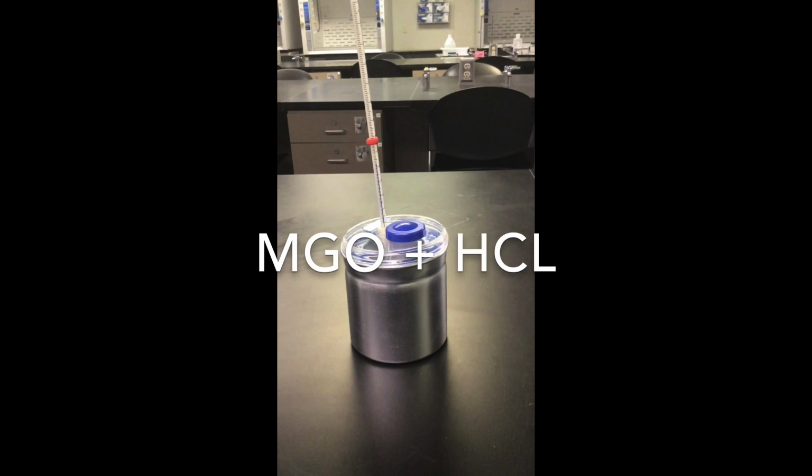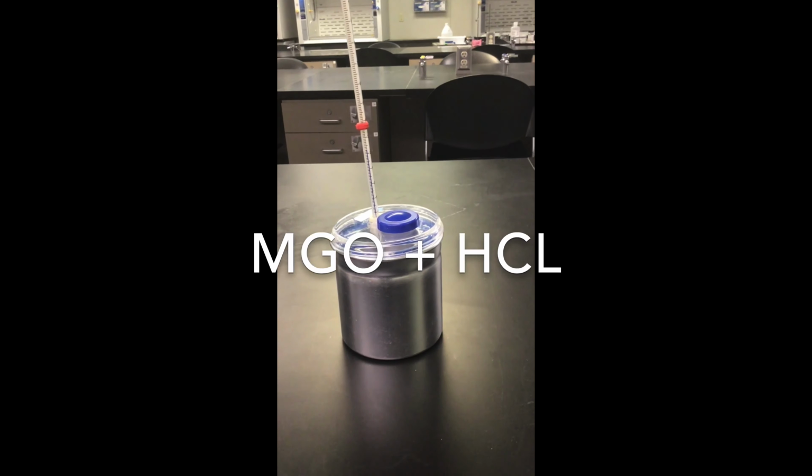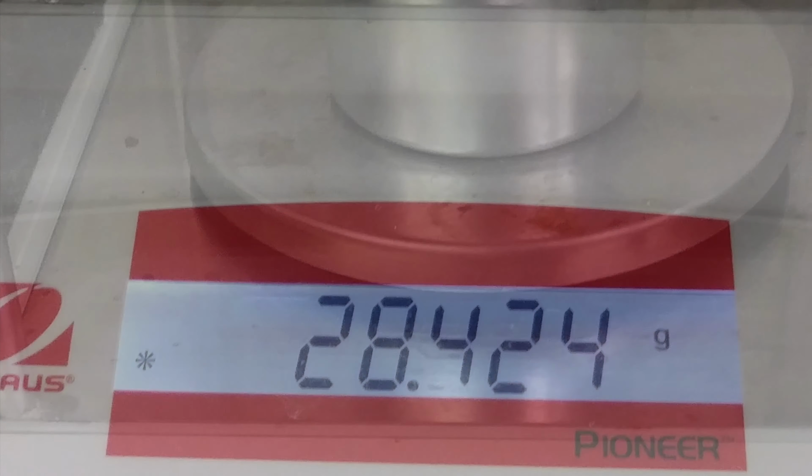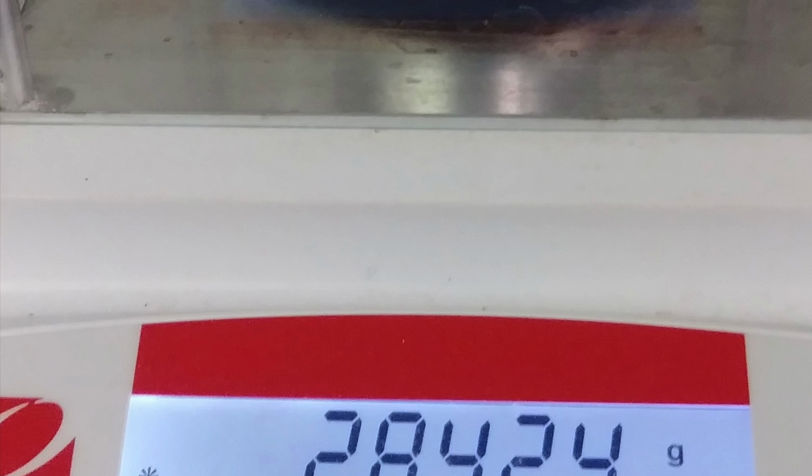For part 2 of the experiment, we will combine magnesium oxide and hydrochloric acid. Starting with the calorimeter, we will weigh the mass of the calorimeter that will be used in this portion of the experiment. Please pause the video and record the mass of the calorimeter.